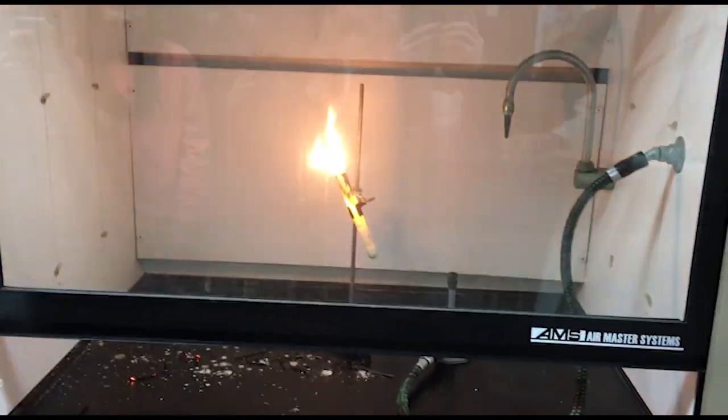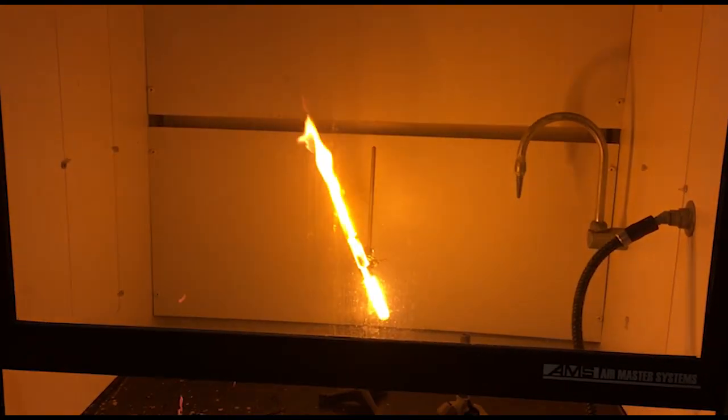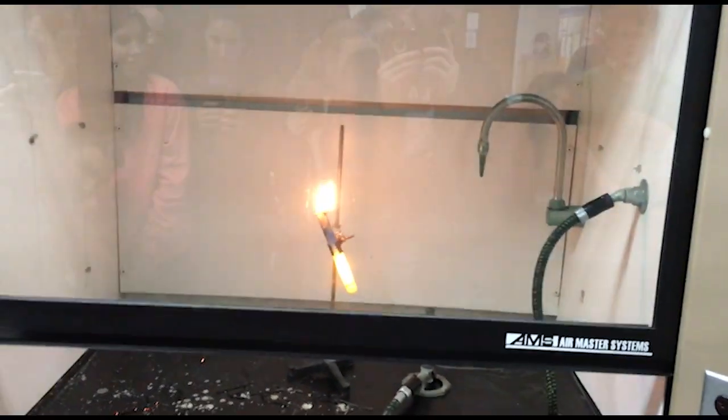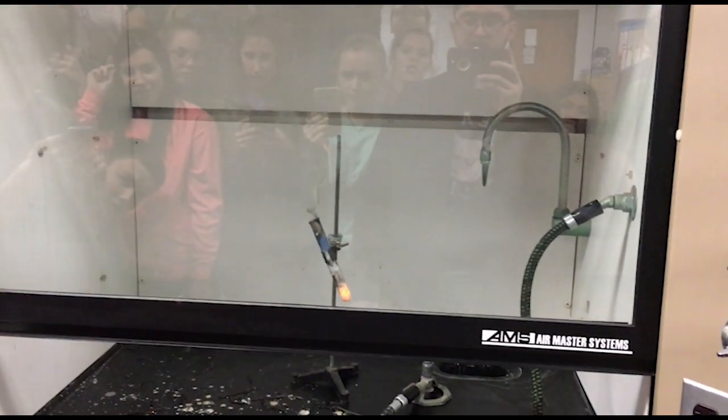It smells really good. Yeah, it smells like a campfire, doesn't it? Coming out of it. So, that's a lot of fuel. Oh, yeah. So we're almost out of oxygen, but I want to use up the oxygen. We made a lot of oxygen. I think that's probably about it. Oh, that smells good. So now it smells like a campfire in here, doesn't it? Yeah. And I love it.